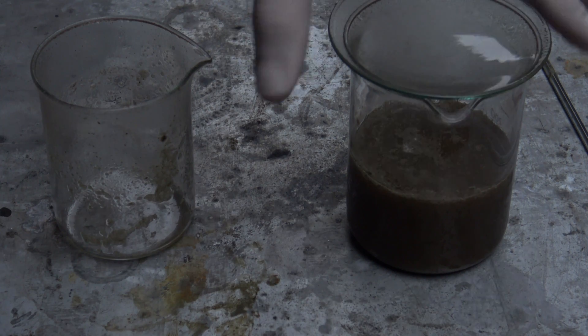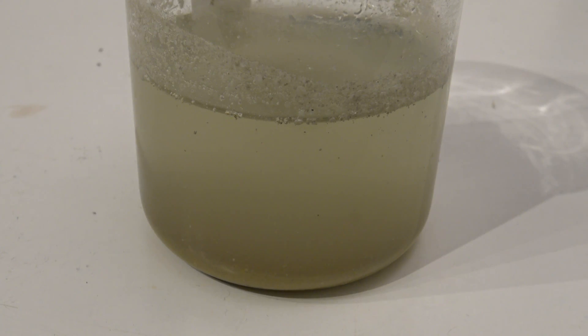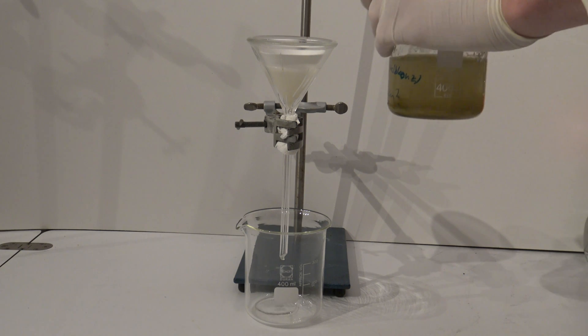Unfortunately, it had to be left overnight, but this was not a problem. All the solids had collected at the bottom and the color of the siloxene became more visible. Then the siloxene was filtered off.